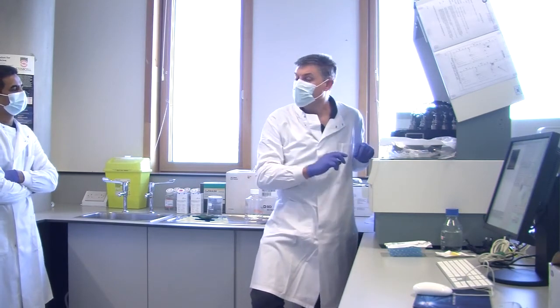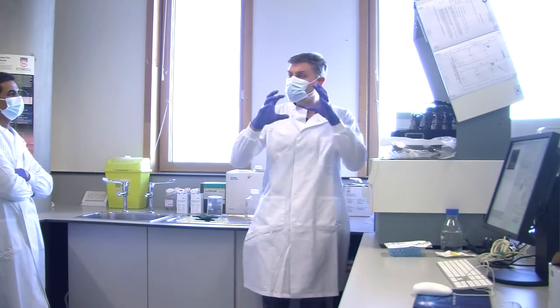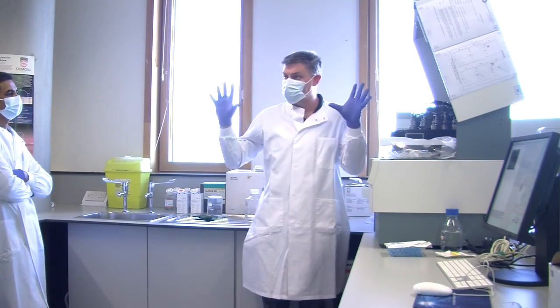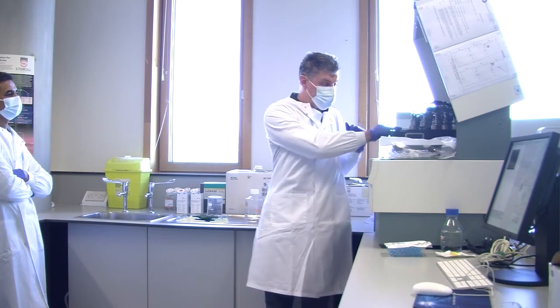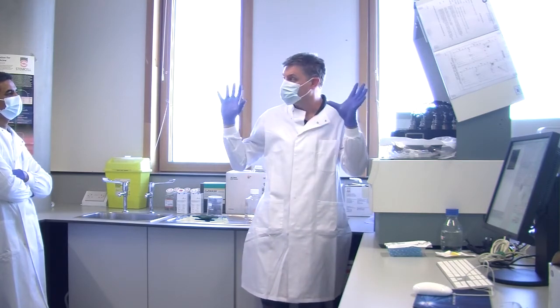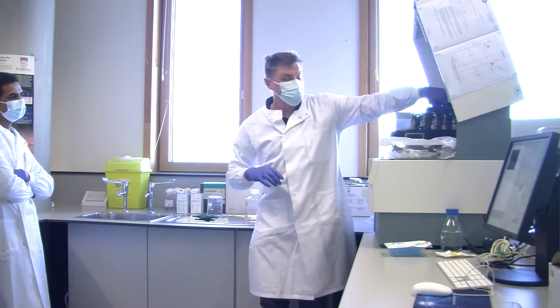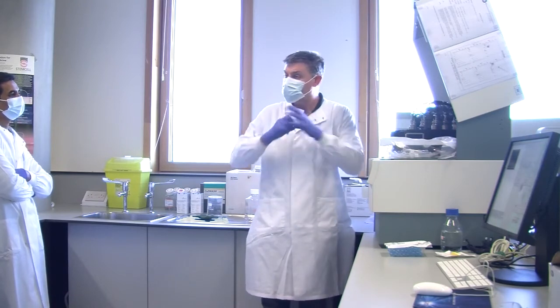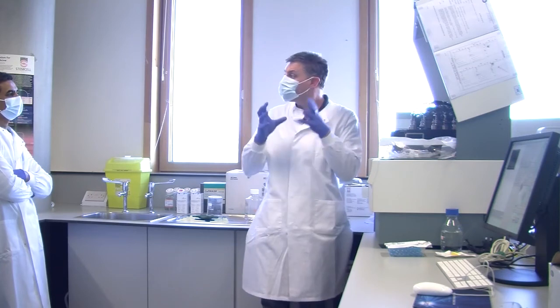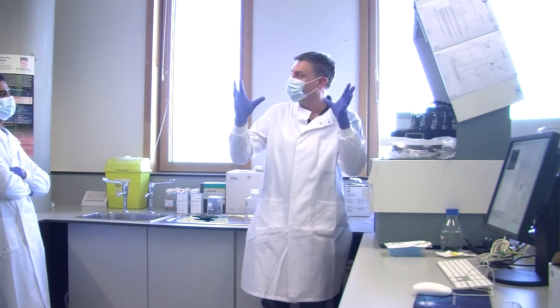What it also does is, when the blue light hits the cell, anything really, really small in the cell will scatter light. Not all of it, the vast majority of the blue light goes straight through, but some blue light will be sent in all directions. And we measure that here, and that's what's called side scatter. It actually goes in all directions, but we measure it to the side.